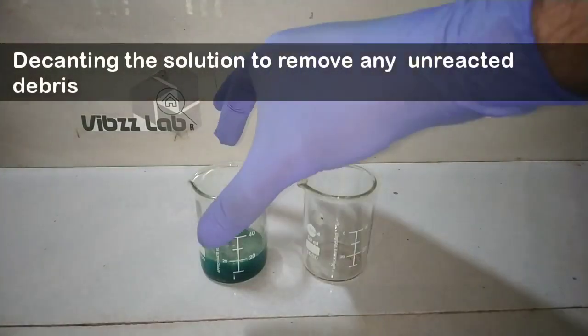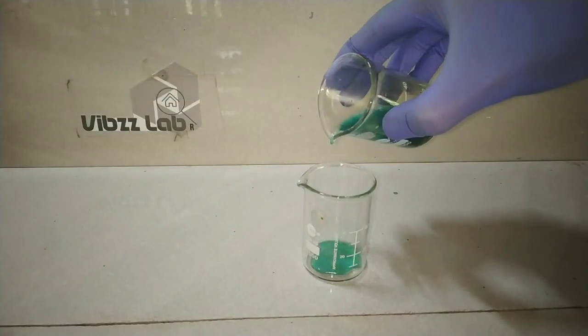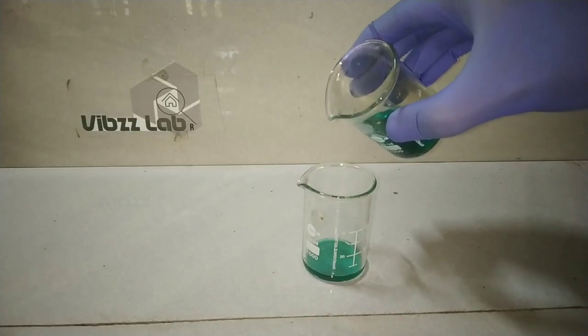The next step is to remove any unreacted debris from this solution. I will just decant the supernatant clear solution and then filter the rest of the solution.